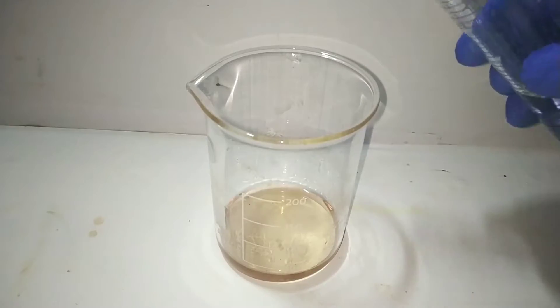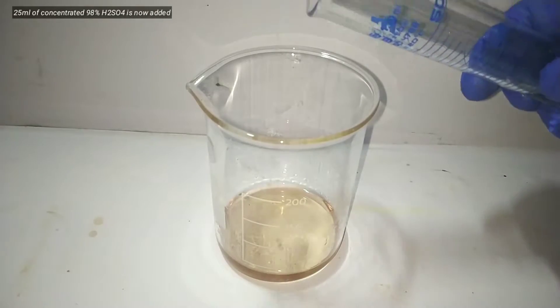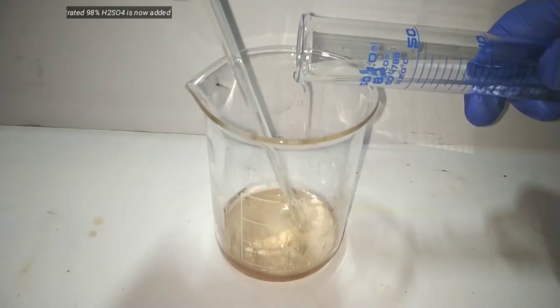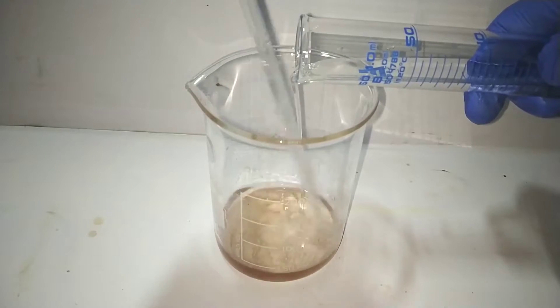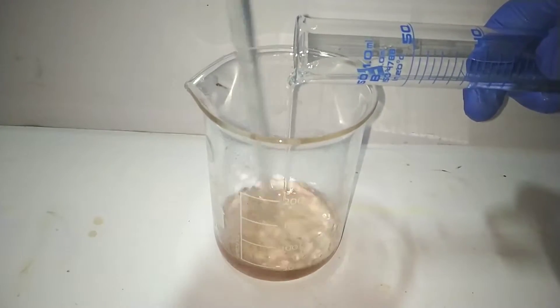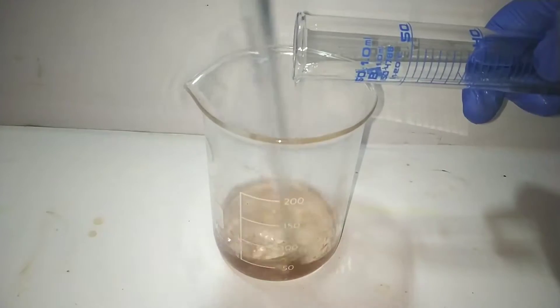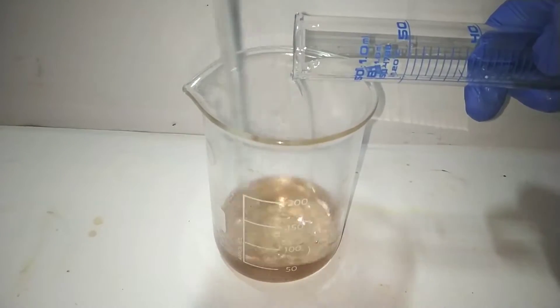Now we add 25 ml of 98% sulfuric acid into this beaker slowly with constant stirring. The addition of acid is exothermic and the mixture becomes very hot, but a clear solution is obtained at the end.